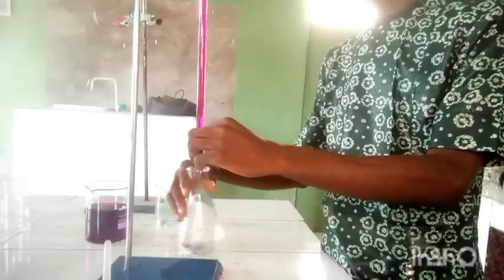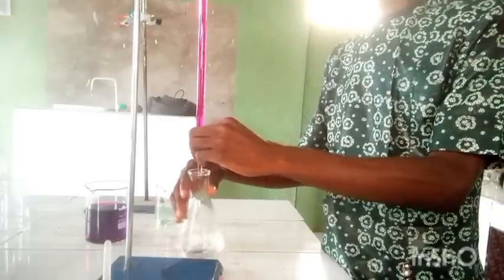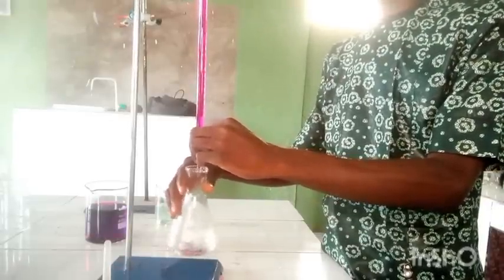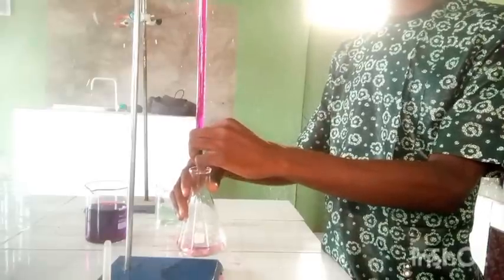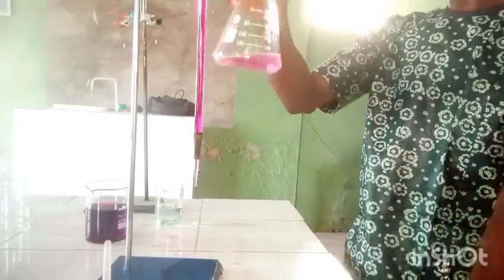Since the second titre value was close to 19.8, I should expect the endpoint to be near that value again, so I slow down the titration as it approaches that point. The colour has changed to pink — this value is close to 20cm³, so we have approximately 20cm³ for the third titre.